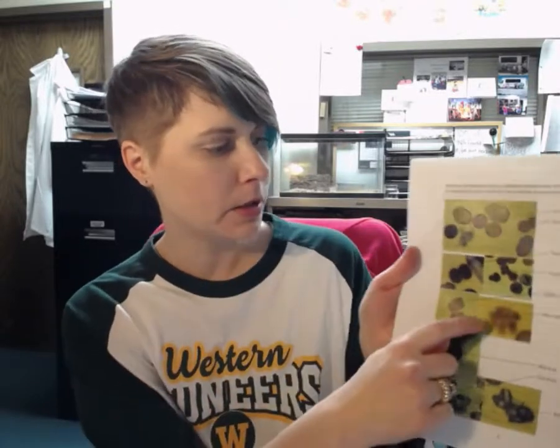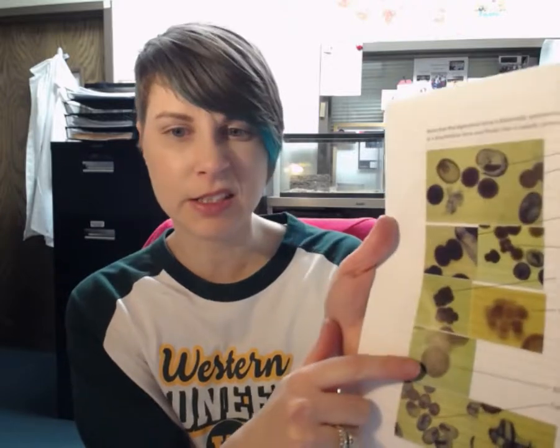And then what was the next one we had to know? The morula, we needed to know about that one. So that one right here, kind of like a cluster of grapes. And then we had to know the blastula. Remember, I don't know if you can see it very well there, but that's a hollow ball of cells. And then the gastrula, remember right here, you're going to see that it already has the blastopore and the archenteron. Remember, the blastopore is going to be the opening into the archenteron. The archenteron is going to be the tube. It's the primitive gut. So make sure that you can identify those as well.